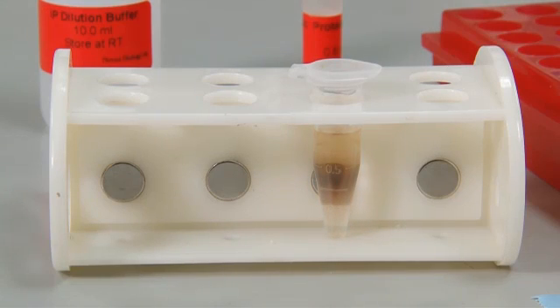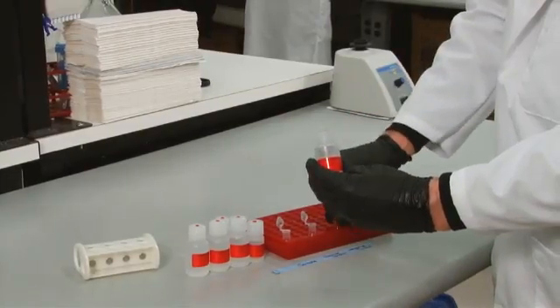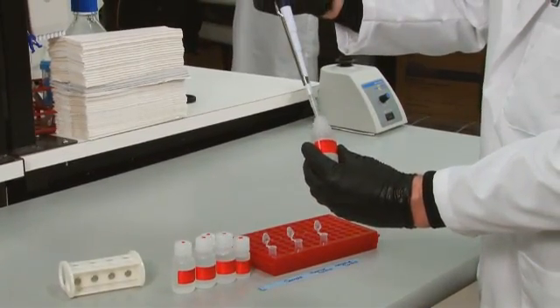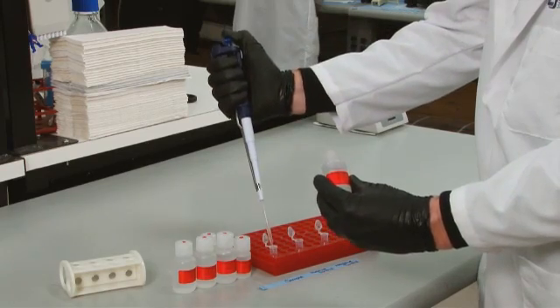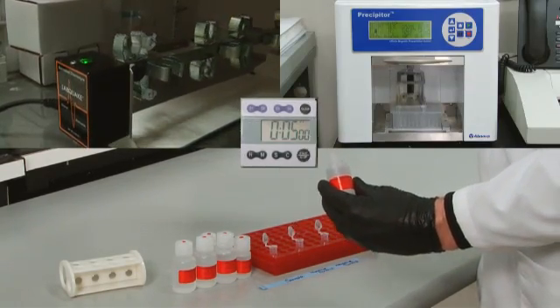Start by pelleting the beads and removing the supernatant. Then add 500 microliters of cold IP wash buffer 1 and wash for 5 minutes at 4 degrees Celsius with rotation or agitation.